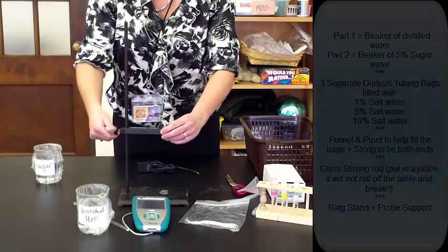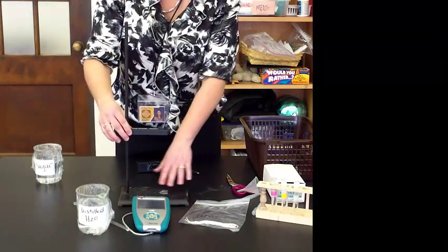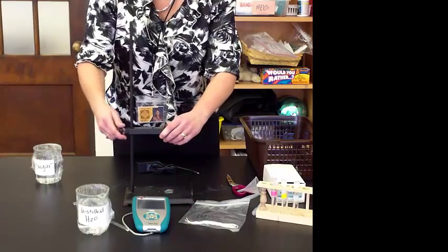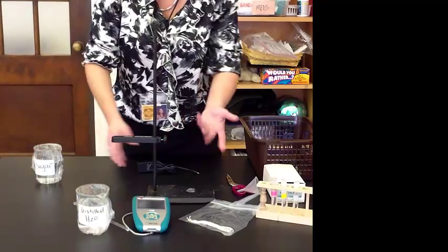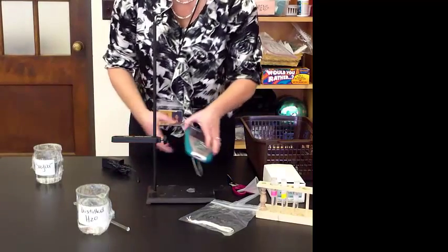So I'm going to set this up like we've done before, and you can either go straight over the base, or if you feel more comfortable, you can swing it around. It does not matter on this, I'll set it up this direction.